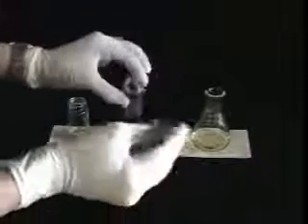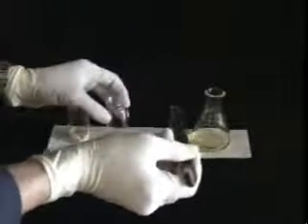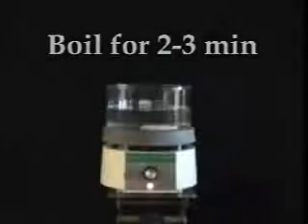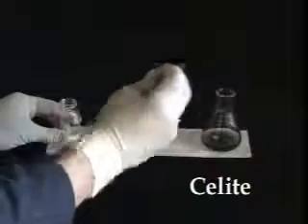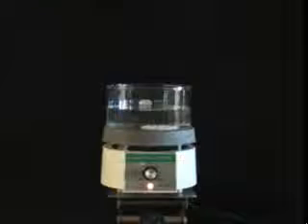Add a small amount of charcoal to absorb the impurity. Do not add too much or the charcoal will also absorb your compound. Swirl the flask and boil it in the water bath for 2 to 3 minutes. Charcoal is very fine and can be hard to remove by filtration. It is easiest to add a small amount of a filtering agent, such as Celite, to absorb the charcoal and facilitate the filtration. Add only a small amount, swirl the flask, and heat it once again for 2 to 3 minutes before performing a hot filtration.